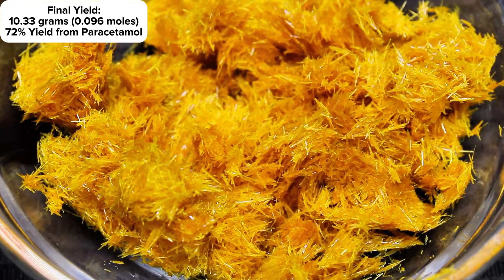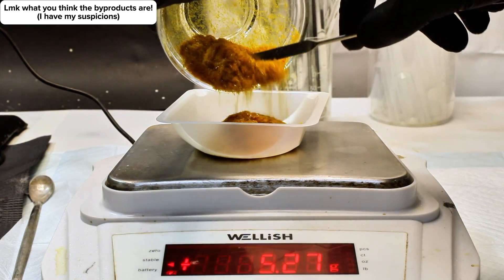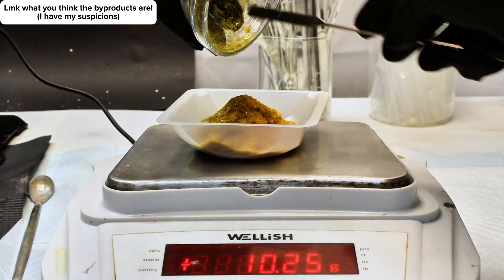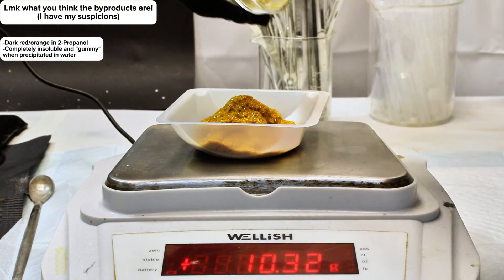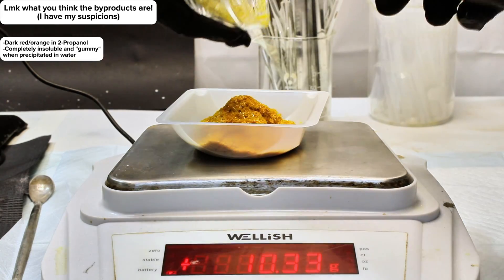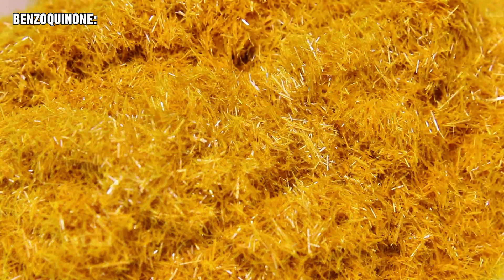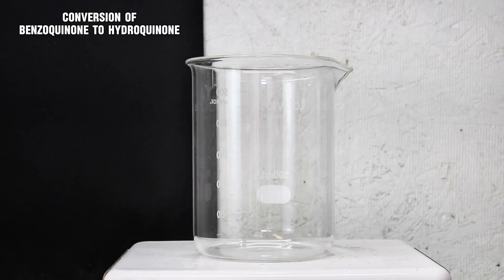Now before I make this into hydroquinone, I want to quickly comment on the byproducts of this reaction. To be completely honest, I don't actually know what they are. I did mess around with the recrystallization filtrate a bit, and found that whatever it is, it's a deep orange, nearly red in organic solution, but a red, gummy, and nearly completely insoluble mess once it precipitates in water. I know benzoquinone isn't exactly stable in acidic solution, and since I let the reaction go over 16 hours when I had planned to let it go only 3, that gave the benzoquinone ample time to break down. What I don't know is what it breaks down into, or if this stuff could ever be useful in some way. If you've got any ideas, I would love to hear them in the comments.